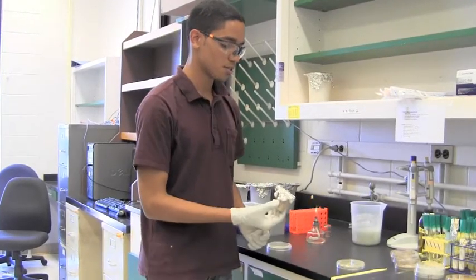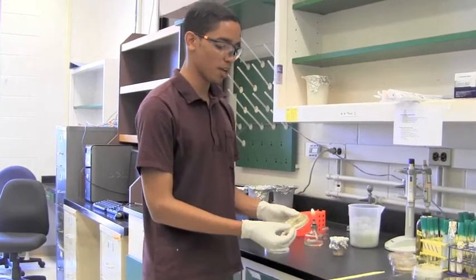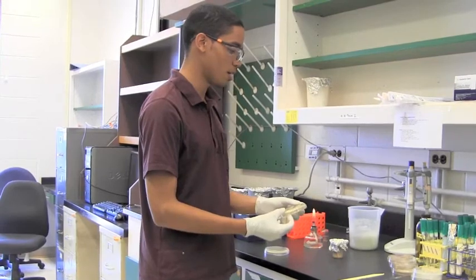You'll need toothpicks to patch your isolate and your master plate or dilution plate from where you get your sample.